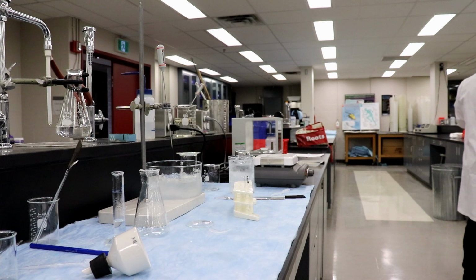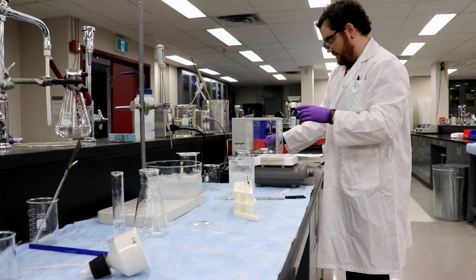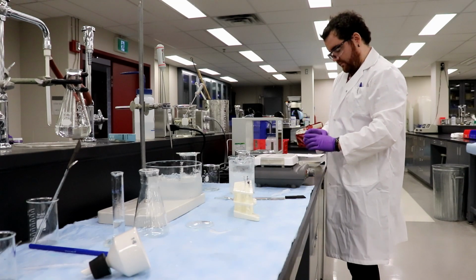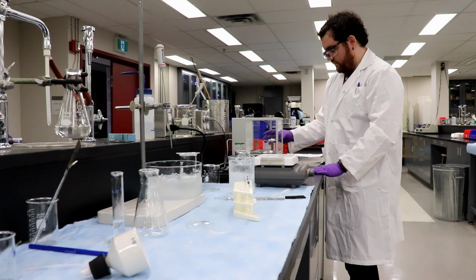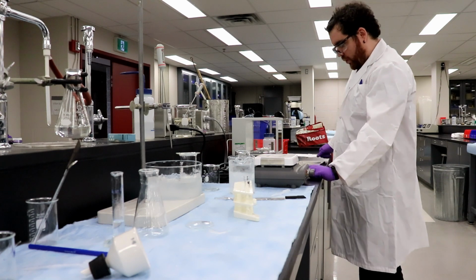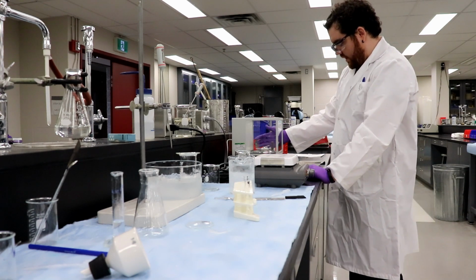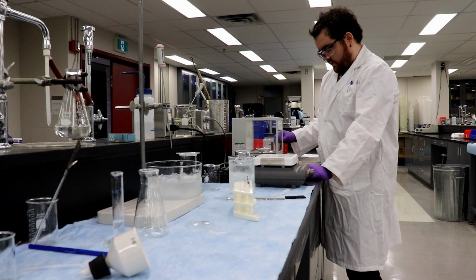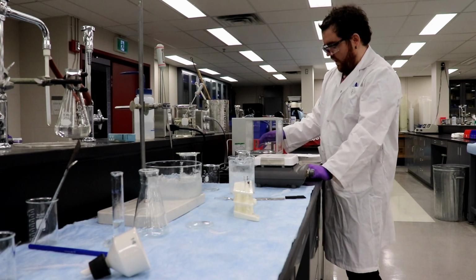Yep. Why don't you weigh it before the oven? Sure. You tared it first, right? Taring it right now. Okay, so this weighs a total of 37.3806. 37.3806. Correct. Okay. We'll pop it in the oven now.